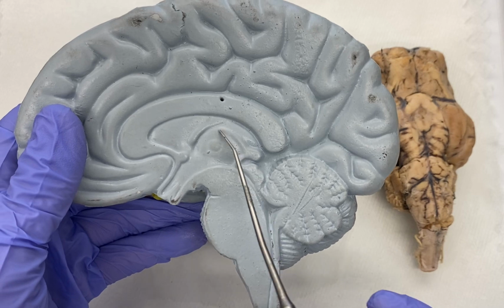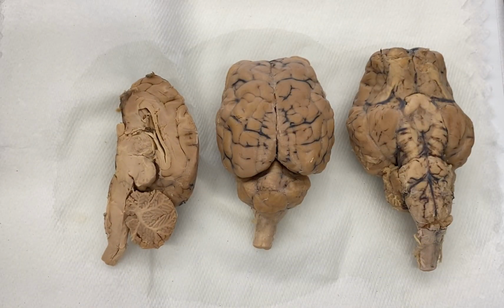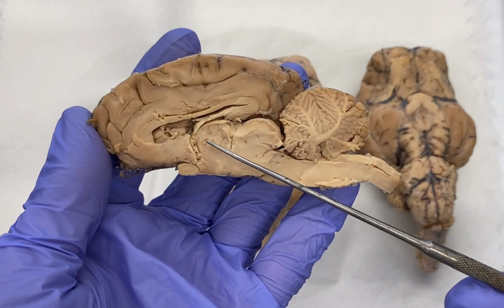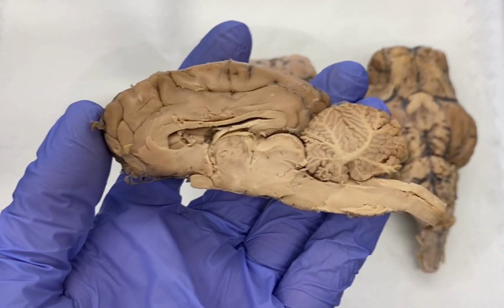The thalamus is largely a relay station, where most sensory information coming from the periphery, so touch, pain, temperature, vision, auditory information, pretty much every sensation except for smell, so olfaction, passes through the thalamus. It may synapse here and then extend up into some other higher brain structure, so maybe the cortex, for example.